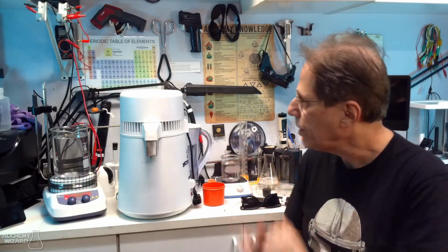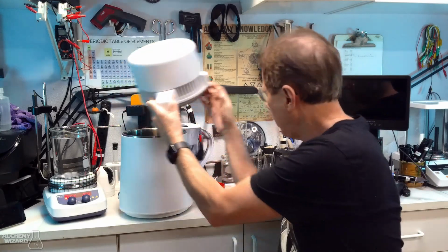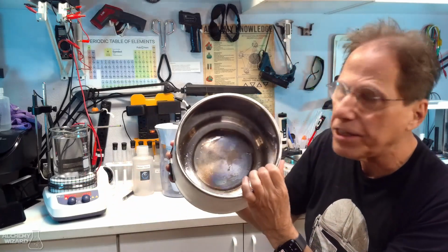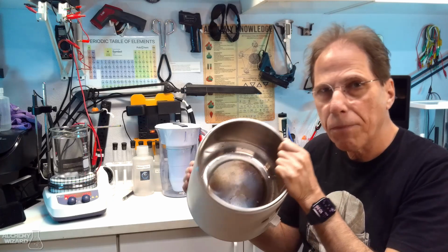So how do we clean this distiller? If you got a lot of sediment on the bottom of your distiller... the bottom of this distiller is actually fairly clean, as you can see. That's because of the way I do it. But this can get really dark, black, and caked up on the inside.